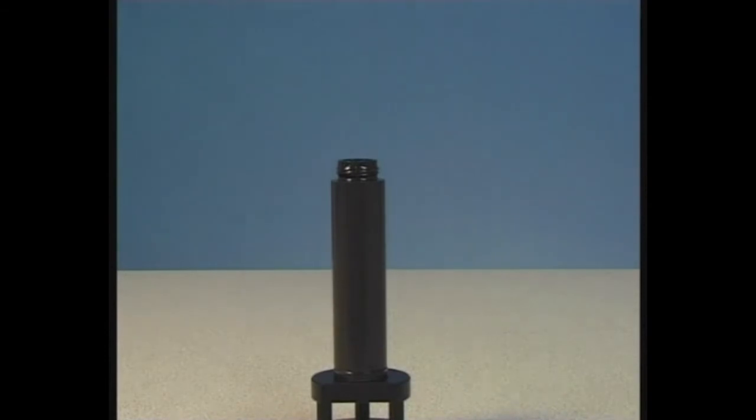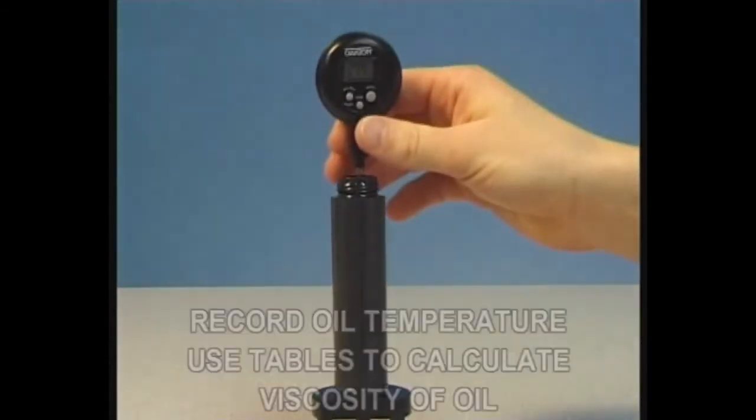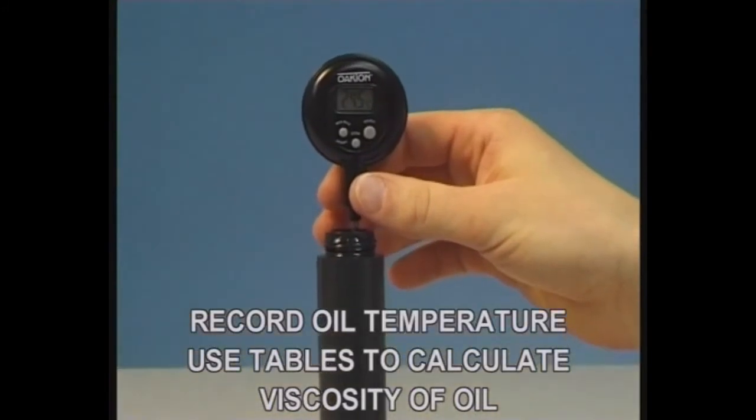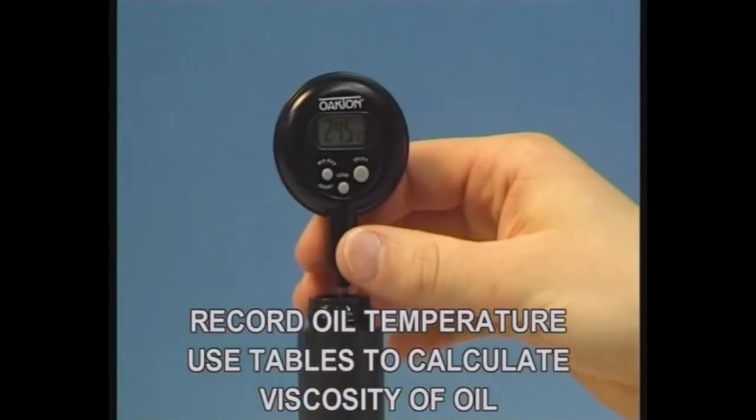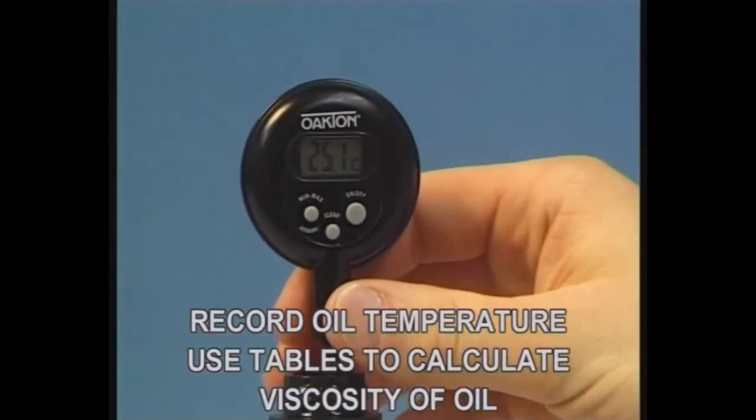Remove the end cap and record the temperature of the oil using the digital thermometer provided. Refer to the tables provided in your manual to calculate the viscosity.